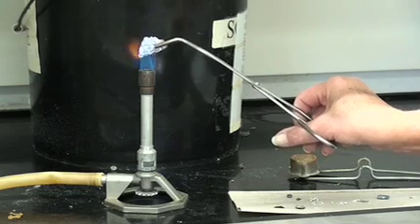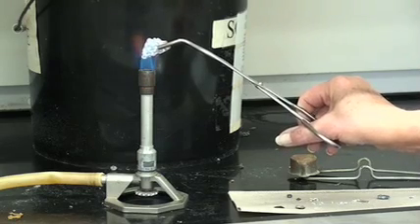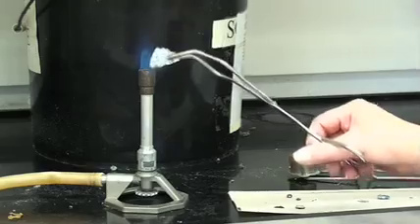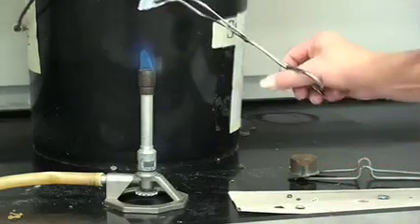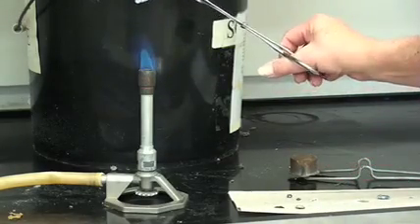I think we've probably been running the silicon for at least as long as all the others combined. I'm going to do it for a little bit longer for you to look at it. And I'm going to pull it out. And it strikes me that the surface is as shiny as it ever was.